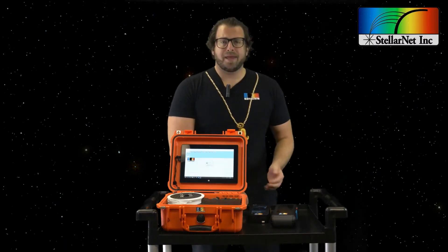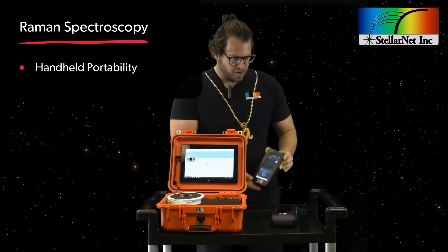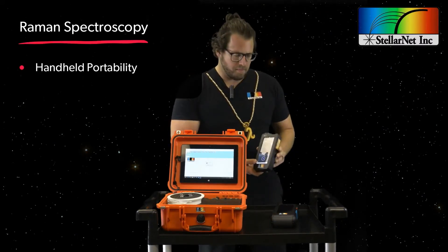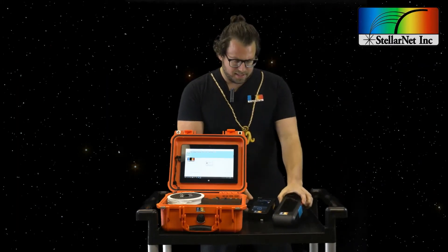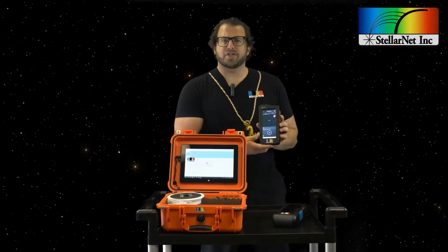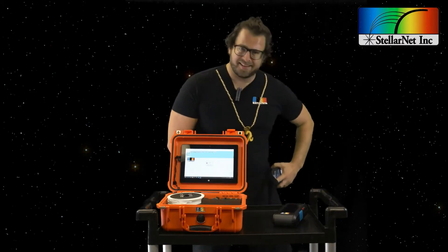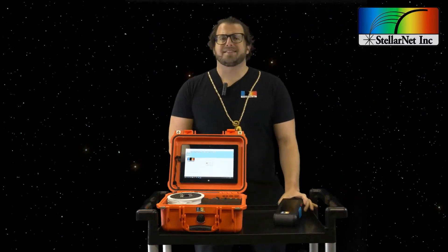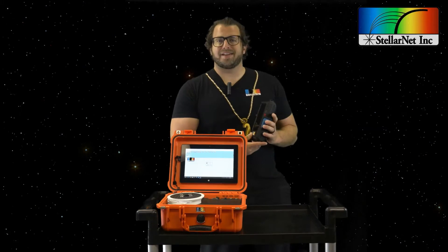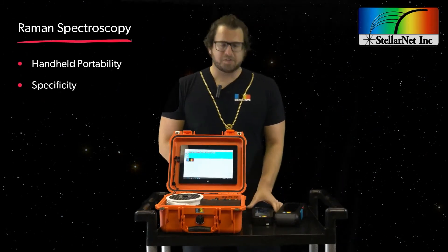Another important factor to consider is portability. Both our StellarCase near-infrared and our StellarRAM handheld analyzers are portable, but our StellarRAM analyzers are truly handheld. We have both the 785 nanometer model and the slightly larger 1064 nanometer model. These can go into your production facility, quality control, incoming inspection, lab, or even your pocket. So if portability is important, the StellarRAM handheld analyzers definitely take the prize.